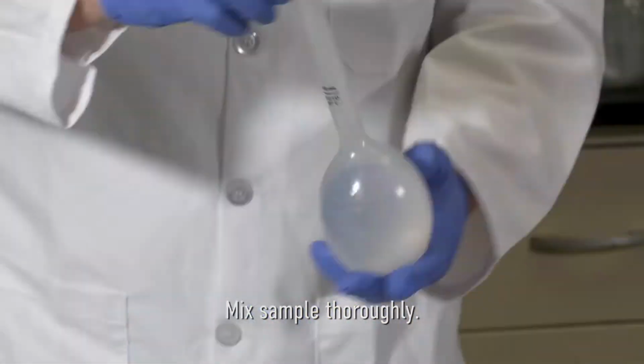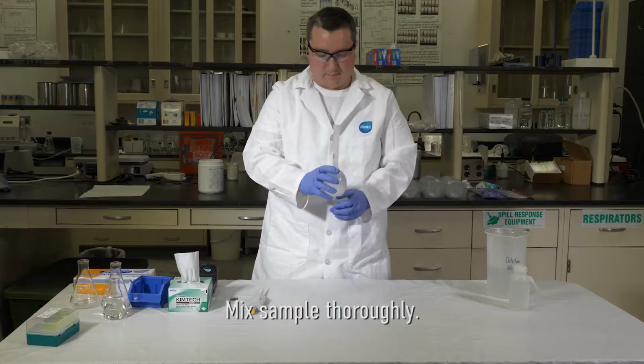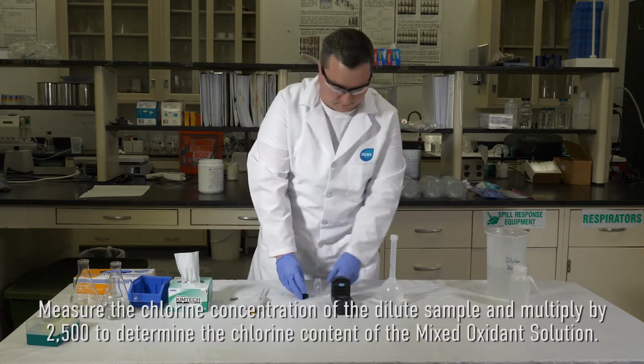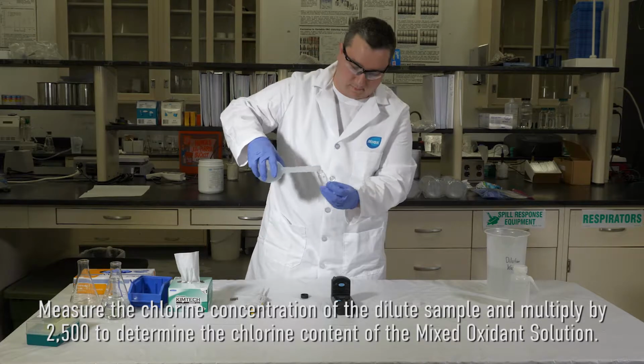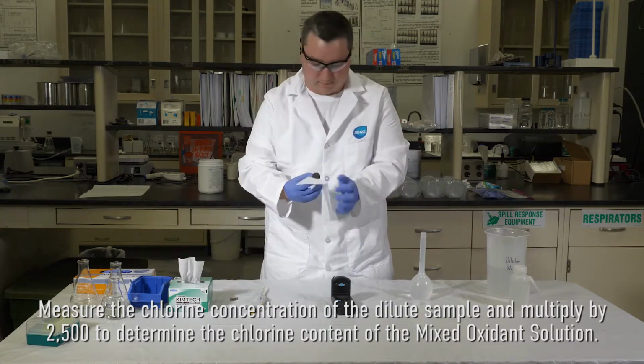Mix the sample thoroughly. Measure the chlorine concentration of the dilute sample and multiply by 2,500 to determine the chlorine content of the mixed oxidant solution.